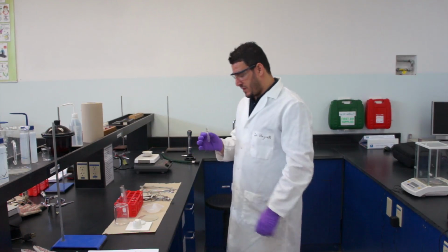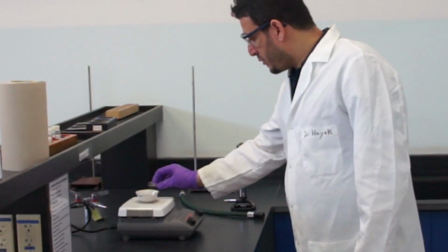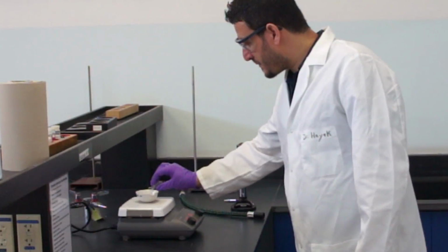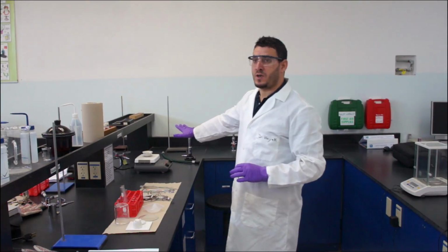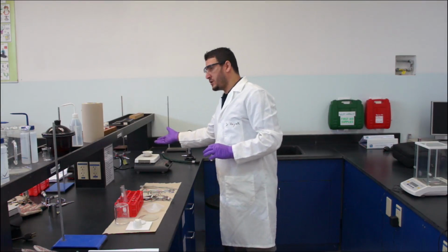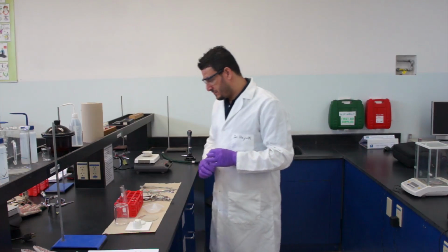Then, what you have to do, you should take half of the amount that you prepared, and pour half of it in the evaporating dish. Okay, so just leave some. Now what's going to happen to the water on the hot plate? The water will evaporate. You will record your observation. You will decide. This change happening here, is it physical or chemical?